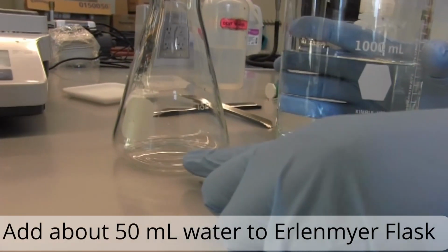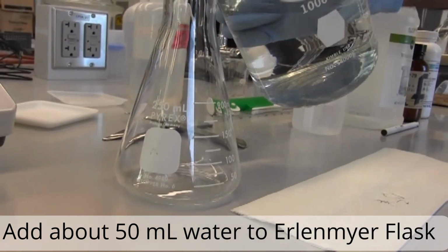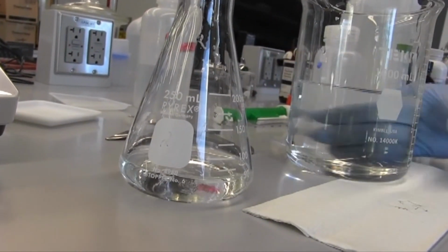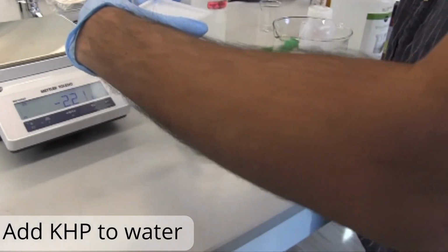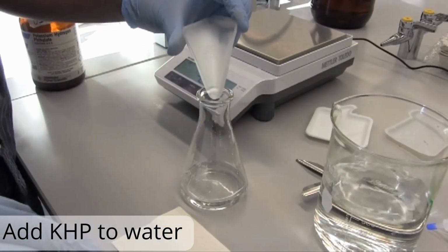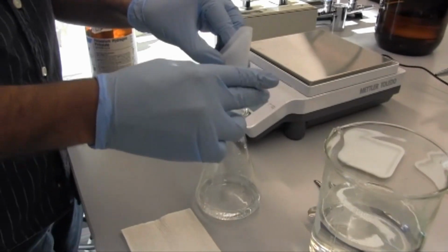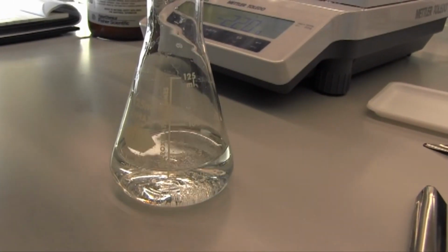Now we will add about 50 milliliters of water to an empty Erlenmeyer flask here. So you see us do that up to about the 50 milliliter mark. Now the amount of water doesn't really matter in this case. We're just using it to dissolve our KHP. What really matters are the moles of KHP, or the moles of acid that we end up using. We've got to make sure to get all of our KHP inside. You'll see its granules forming at the bottom there.